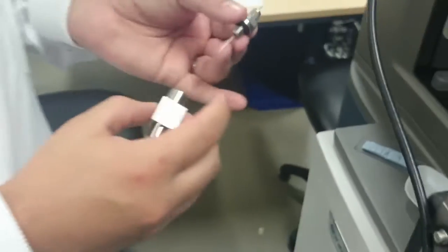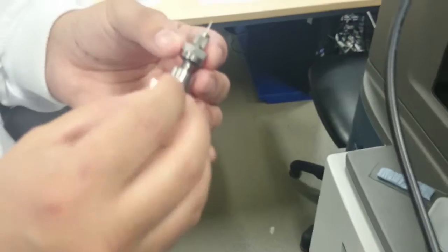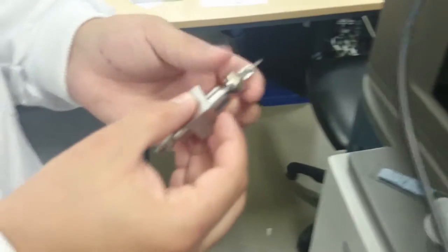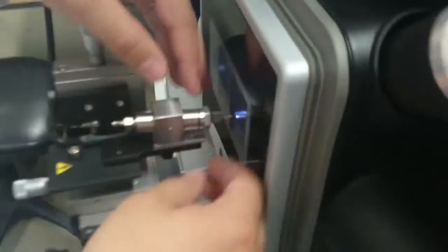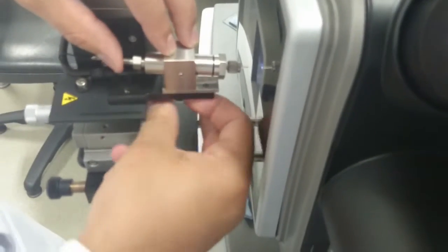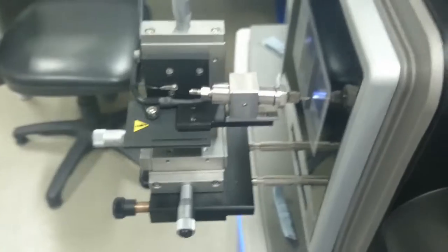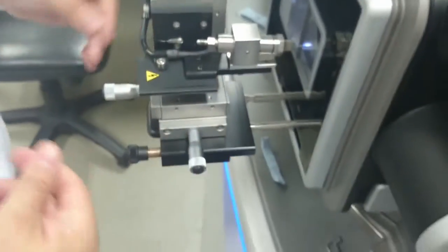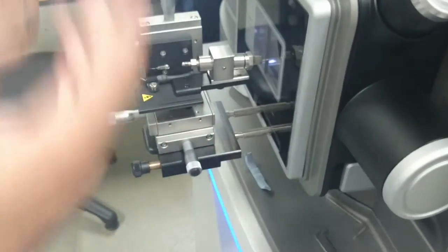When you've got the tip inside, make sure there's a connection at the end and put it inside the metal source block. And you want to screw it up finger tight. Then place this on the instrument. Now, this instrument is a Synapt G2. Depending on your instrumentation, this may have a pull-out sideways source or other housing systems have a different orientation entirely. It's specific to what you need to do on your system. I'll point out key features that are common throughout.